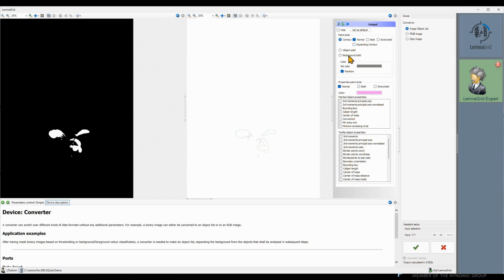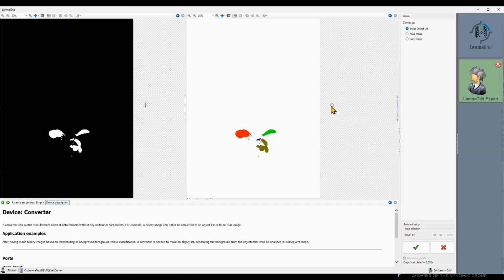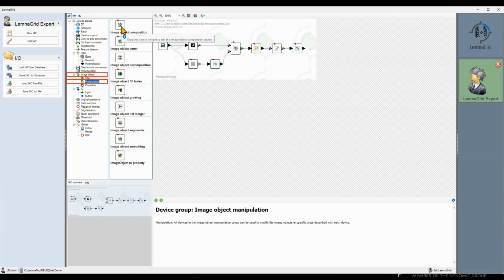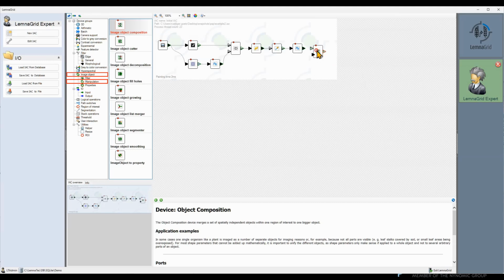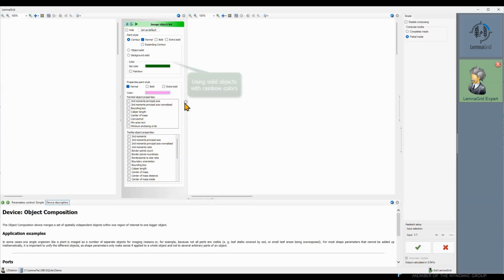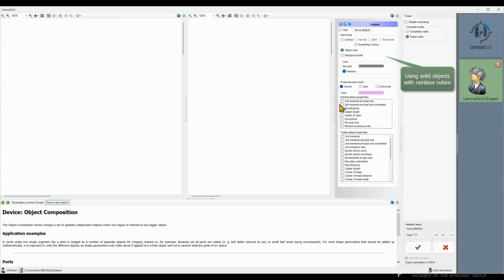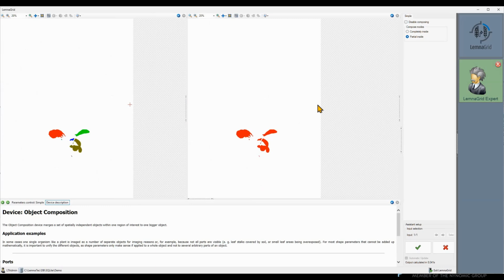We use rainbow-colored solid objects. We have multiple objects in the image now, as indicated by the different colors in the rainbow coloring. If we want to have information about the leaves together, we need to merge them somehow. This is done by the image composition device. All objects are now merged into one object and can be measured as one entity.